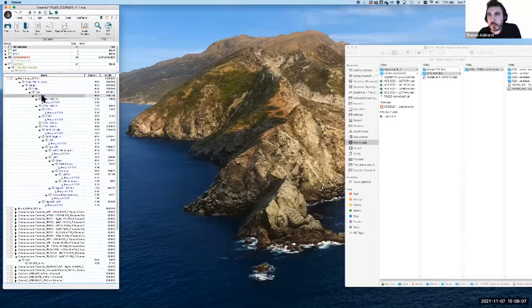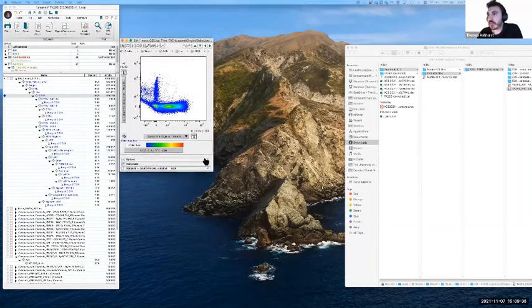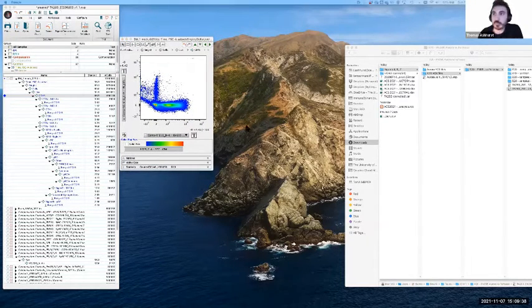The classic thing here, which can come up, is when we get pairs of fluorophores that look like they might be the culprit, but they don't really make a lot of sense. What I mean by this is when something just isn't right. There's something wrong with the way the data looks, but you don't know why. You can see kind of evidence of that curve, but it's doing it in a way which is not consistent. So let's take this example. This is one I prepared earlier. I'm just going to expand this a little bit to make it easier to see.